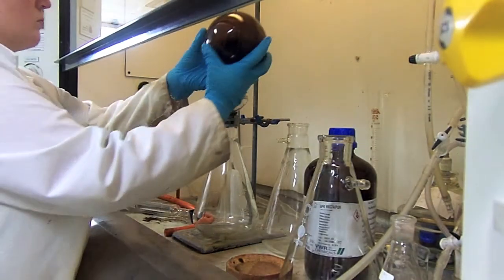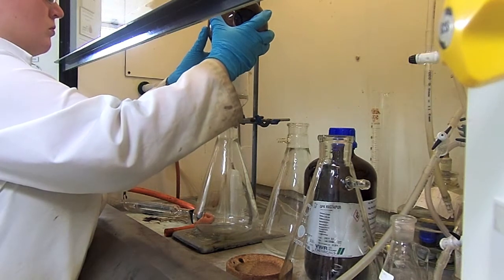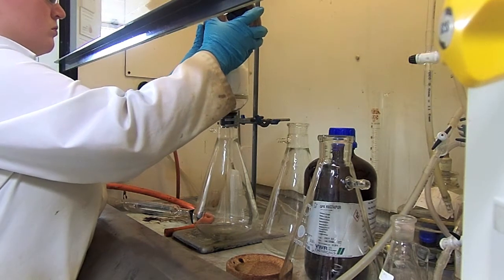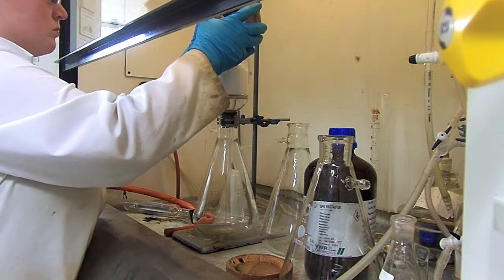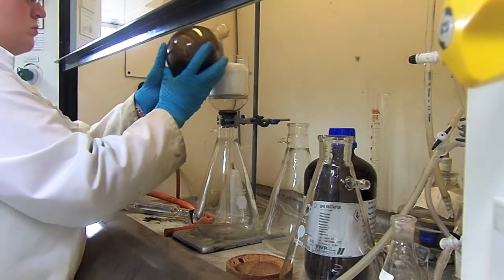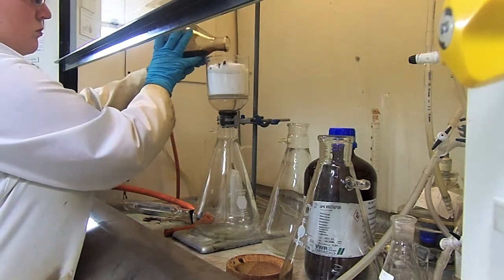Add the porphyrin solution slowly and carefully to the cotton wool layer, being careful not to disturb the silica underneath. Wash the flask out with more solvent once you've added the porphyrin to ensure you've added all of the porphyrin product.